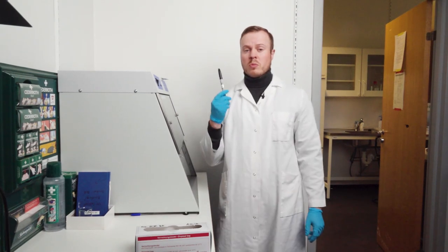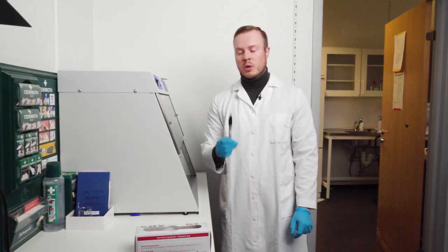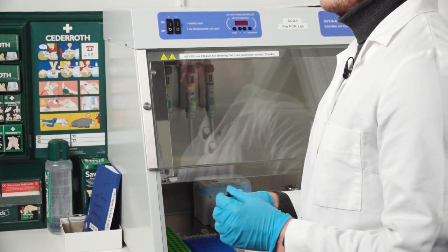And lastly, it's always smart to have a sterilized marker because we will need to mark a lot of the samples when we are working in the UV cabinet.